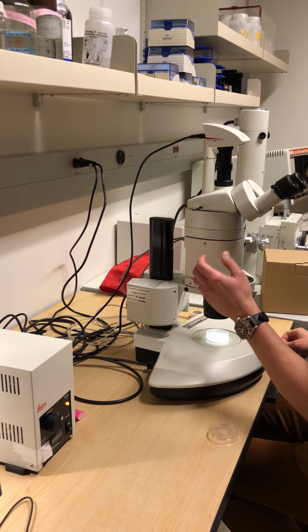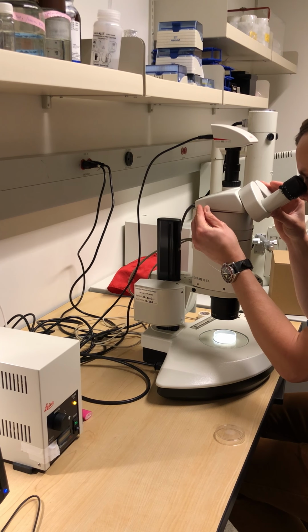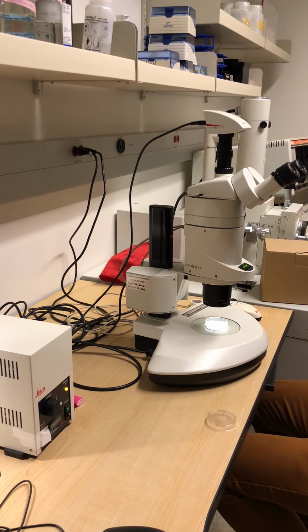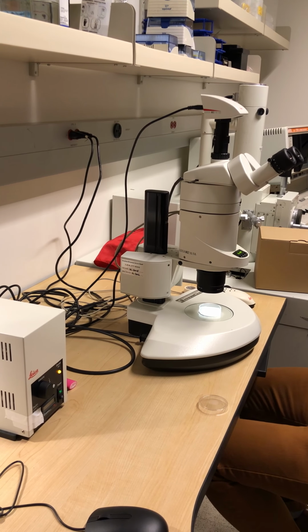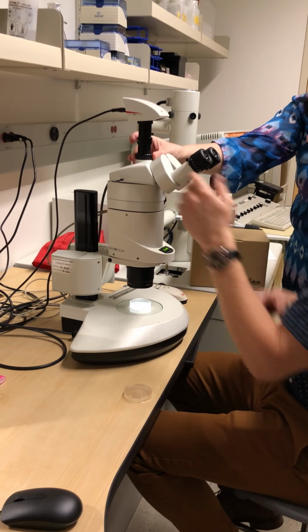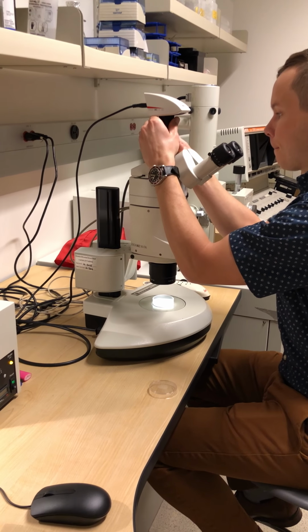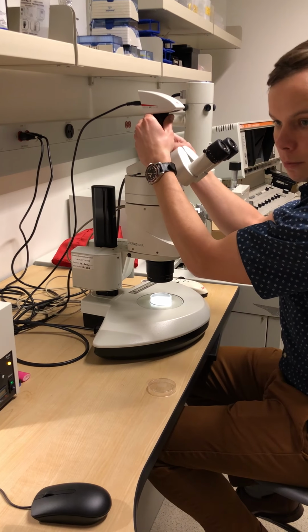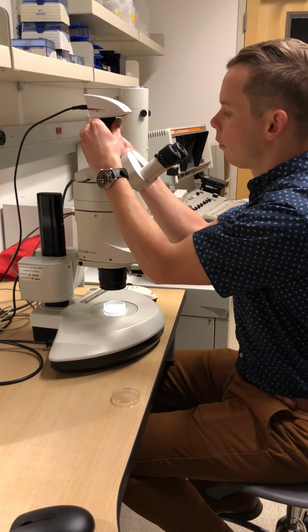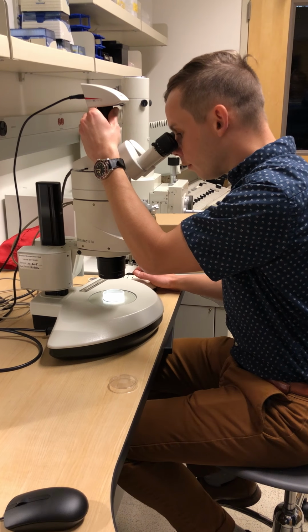It's annoying. I don't like when that happens. Camera versus eyepiece, that's an annoyance, I have to say. I'm trying to think if I can adjust it on this one. You can adjust it on our compound scopes. Is there any way to move these? You can. Sometimes you get used to working with a monitor, but we can adjust this.